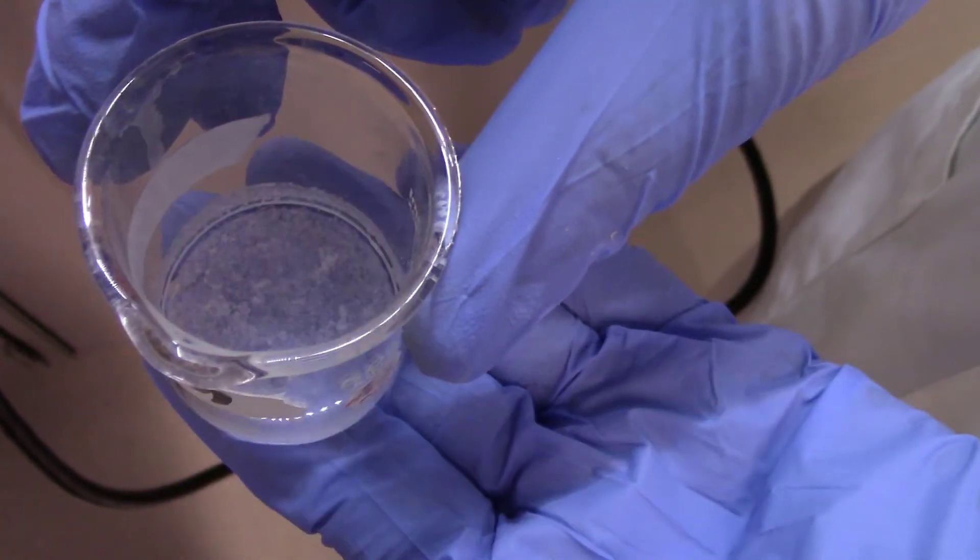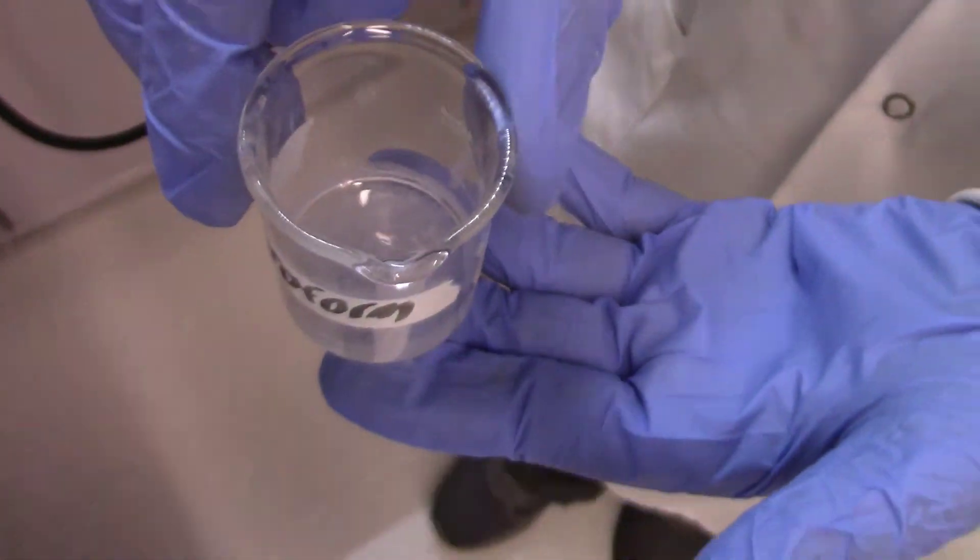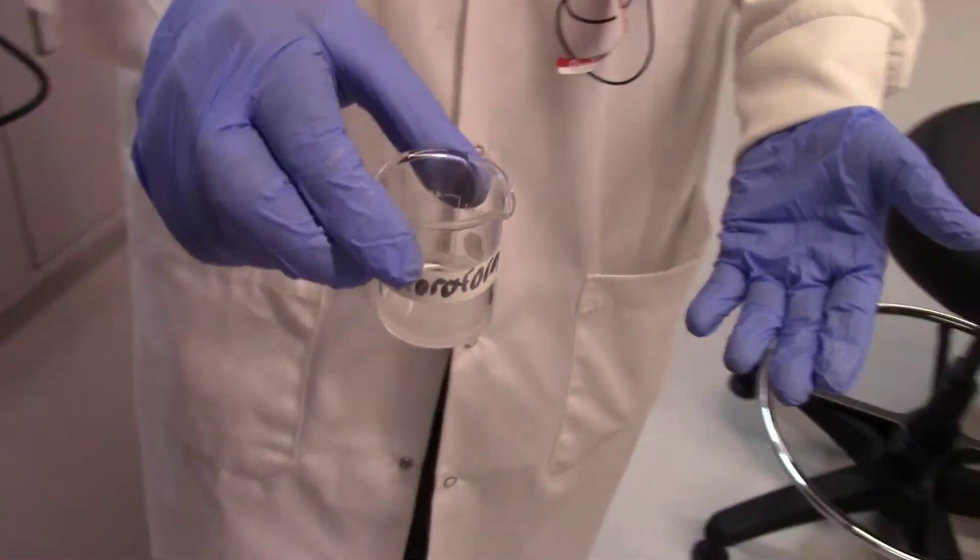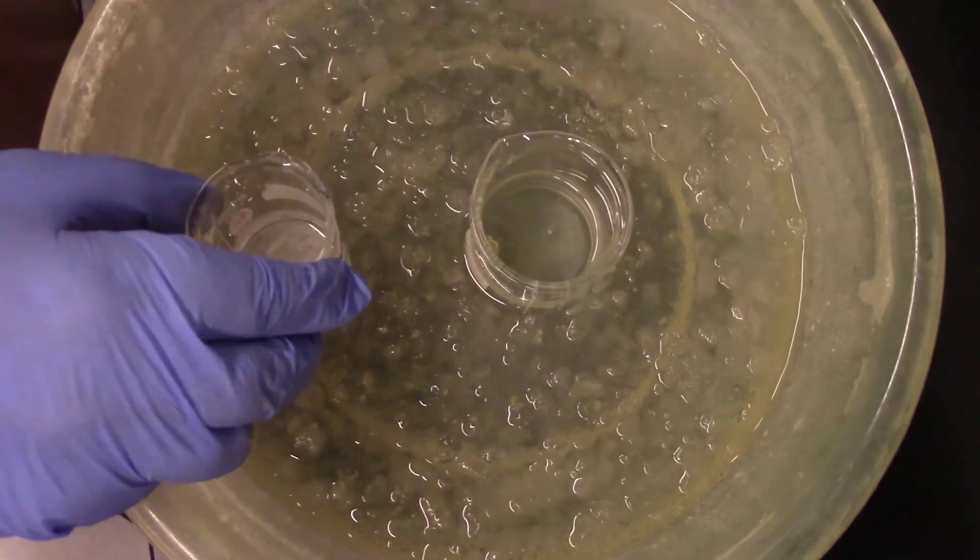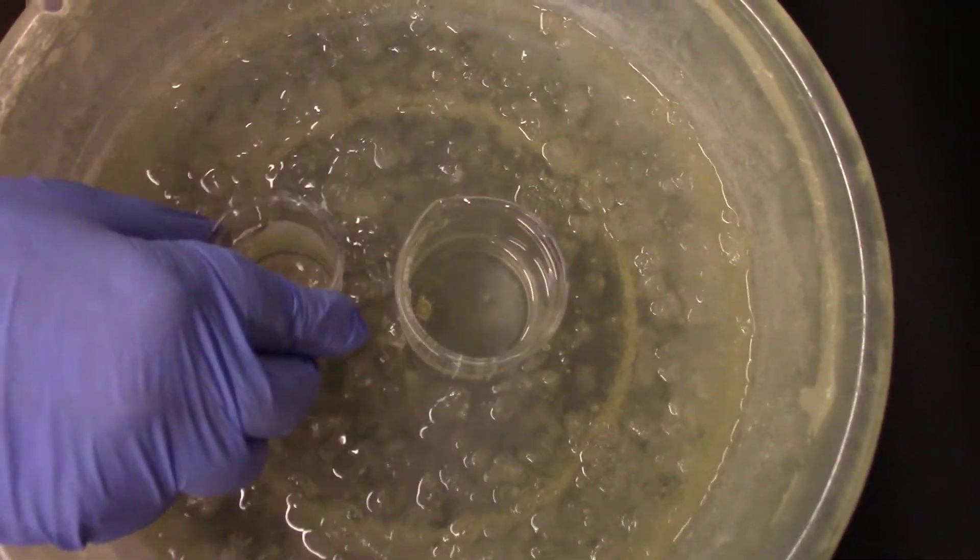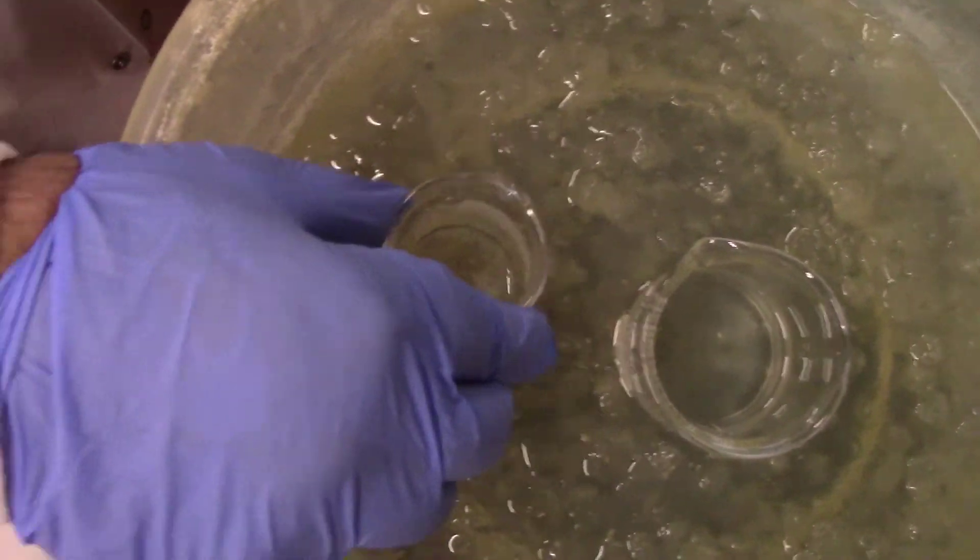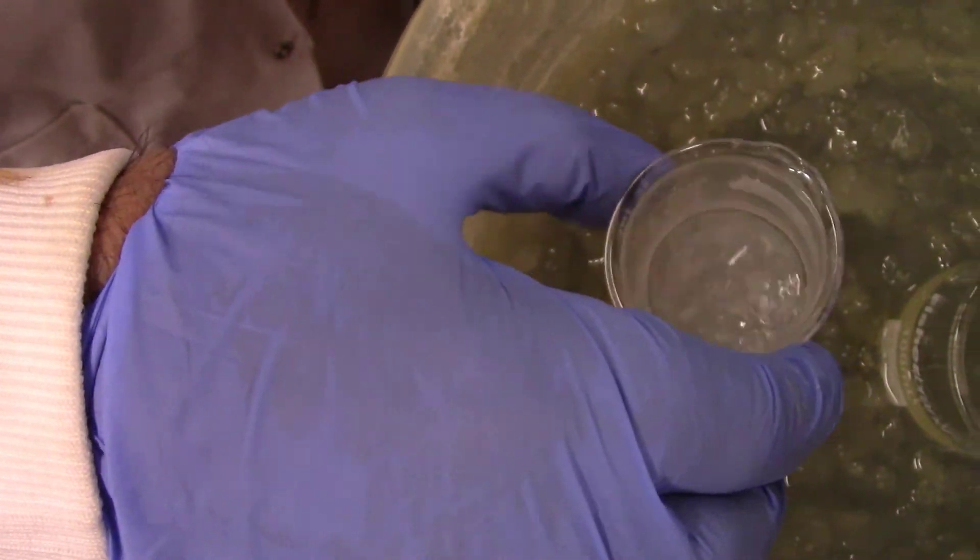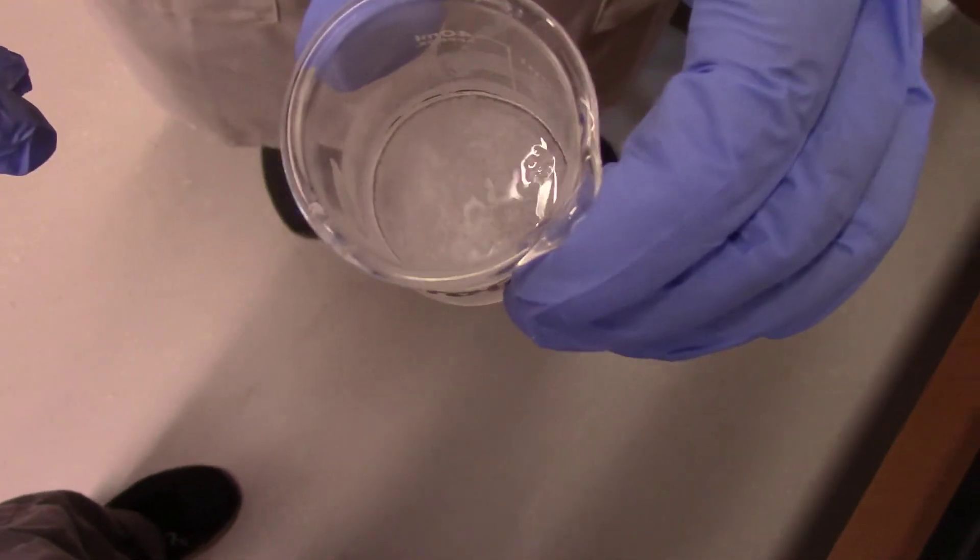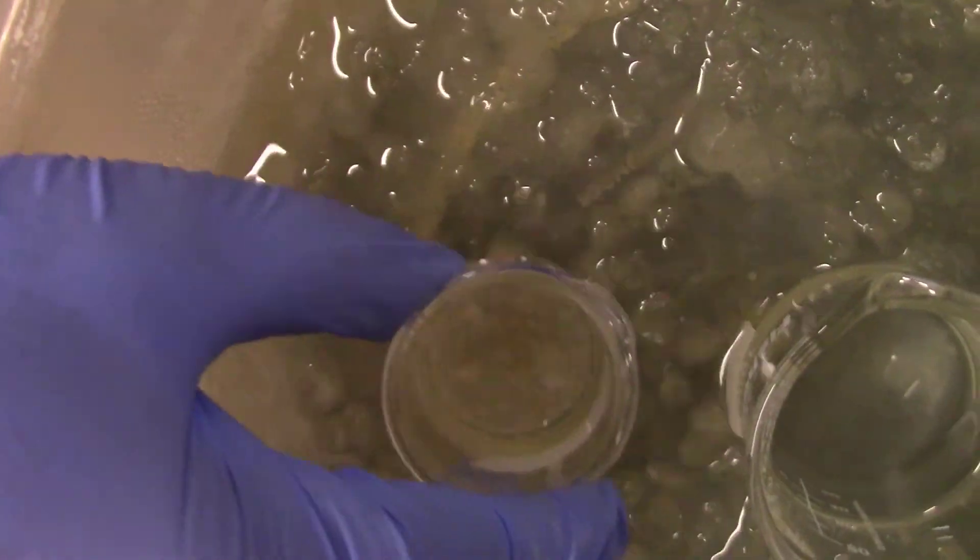We need to actually cool it down first at room temperature and then in ice water mixture for about 10 minutes. You can occasionally swirl it as well. Swirl it - you don't have to be there. Just leave it there for about 5-10 minutes and then swirl it again. Then you should see more crystals are coming out. The longer you keep it in ice, the better yield you should be able to get.